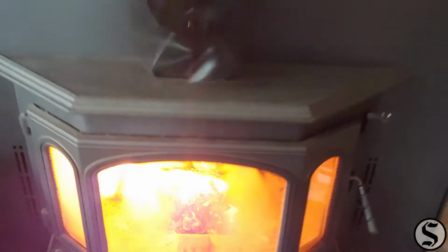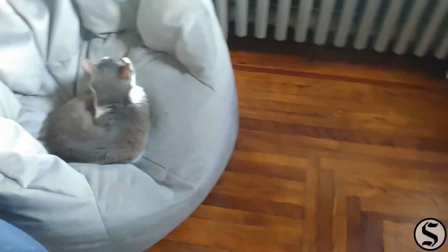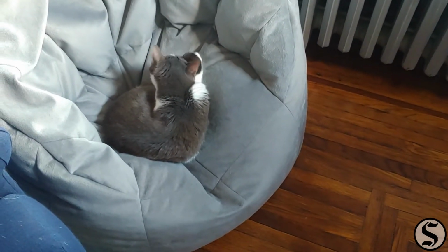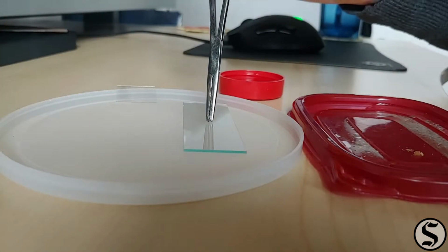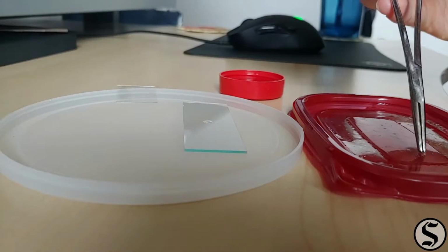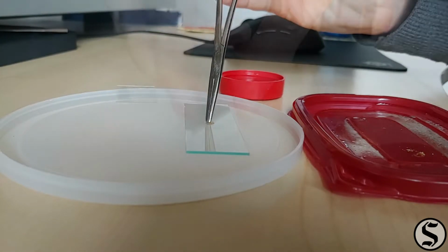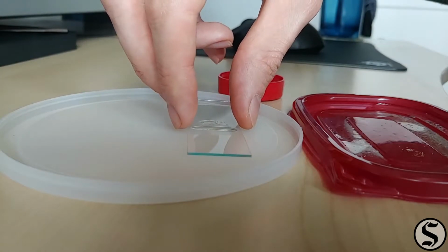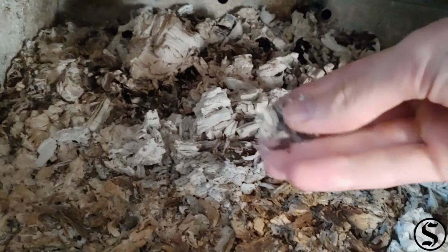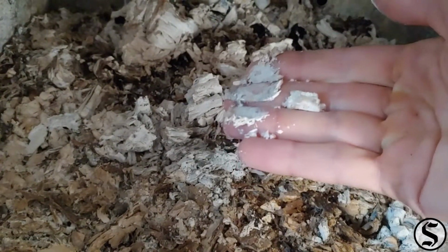Today's sample comes to us from my fireplace, which, incidentally, is my cat's favorite thing in the entire house during the winter months. Now, I can't put fire, of course, in my compound microscope, but I can put ashes in, and I figured it would be useful to look at some pre-ash material first, so I got a little sawdust on there, but I've also got some dark ash and some white ash for us to investigate.